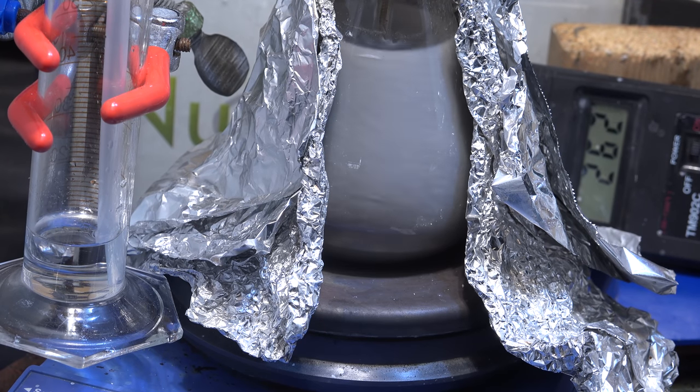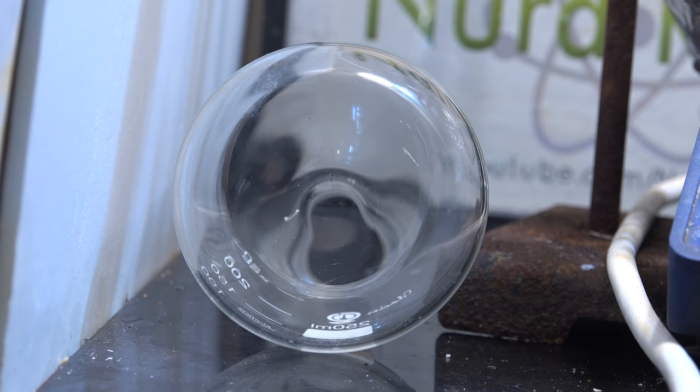Unfortunately, this didn't work either, and the reaction was still extremely slow. Even after a week of heating, I was unable to obtain any lithium, and the reaction mixture only barely reacted with water. So while it does look like it's possible to make lithium, it's totally impractical due to time constraints. Nonetheless, this experimental failure isn't a total waste. After cleaning the flask, it was shown to not have been damaged by the lithium hydroxide at high temperature. This would be a useful piece of knowledge if in the future we tried to make lithium by other means like electrolysis. I'll keep thinking on this.